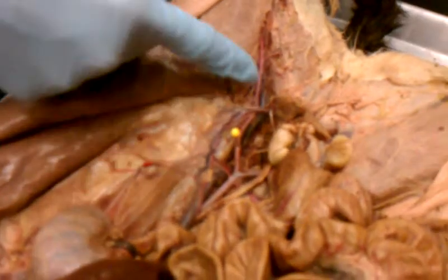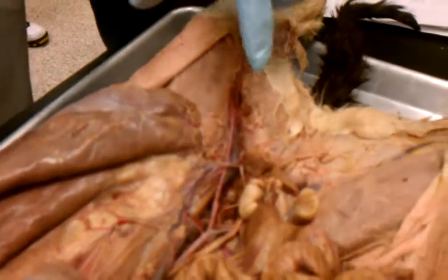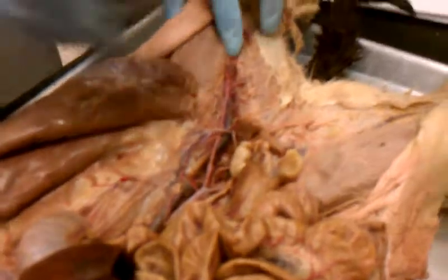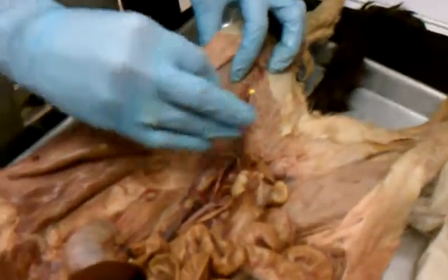The one on the outside, if I pin right here, that's the external iliac. And then once you reach the femur, that's the femoral artery. So if I pin the femoral artery, I won't pin it up here. I'm not going to make y'all feel around for the femur and guess where it's at. If I pin the femoral, it'll be somewhere down here. Okay?